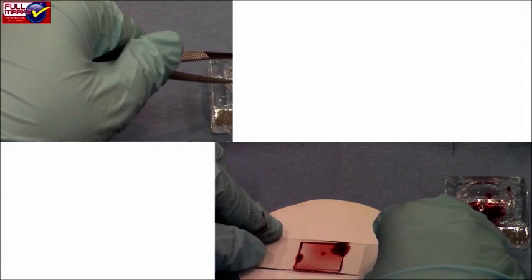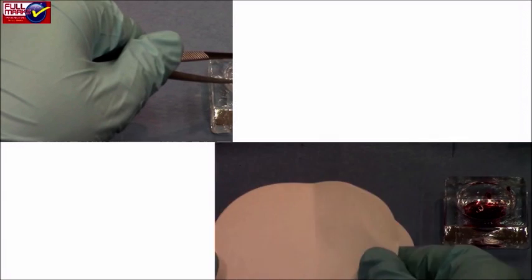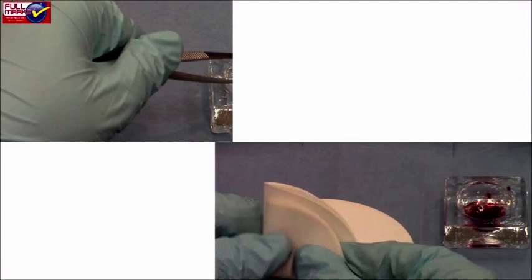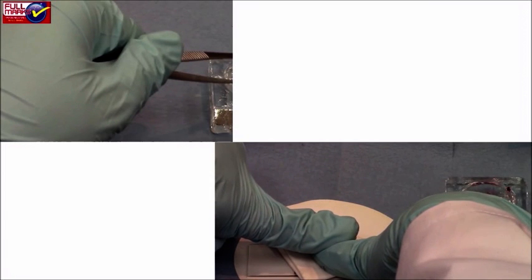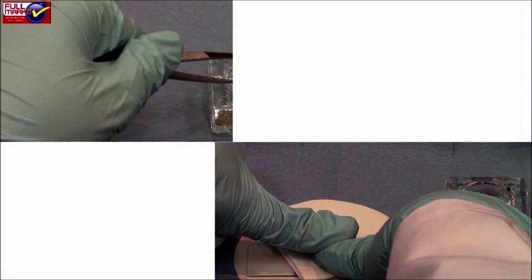The slide is then gently covered with a cover slip, taking care so that air bubbles are not formed. Warm the slide gently and place it between two folds of filter paper.